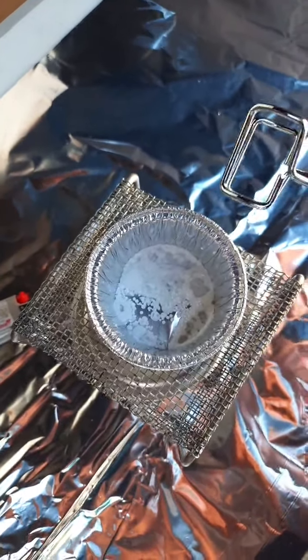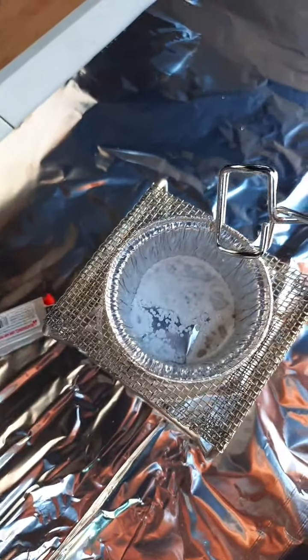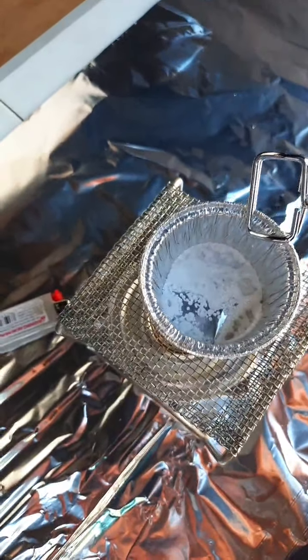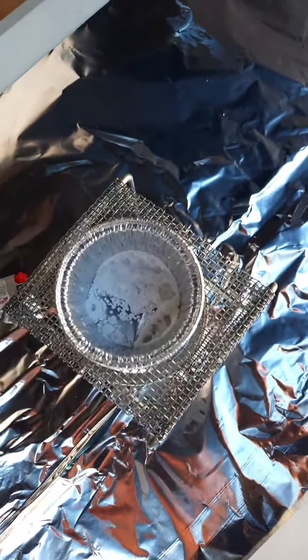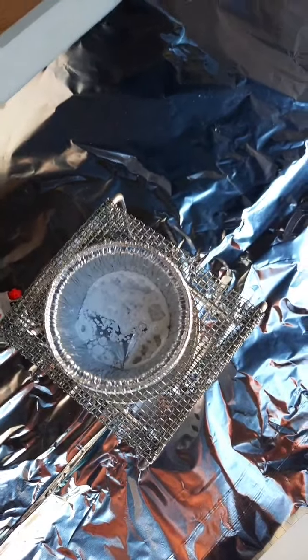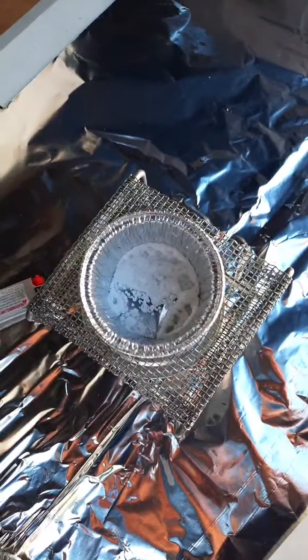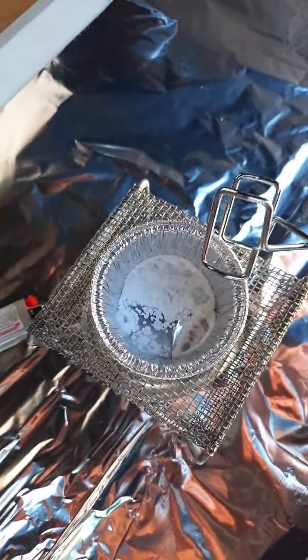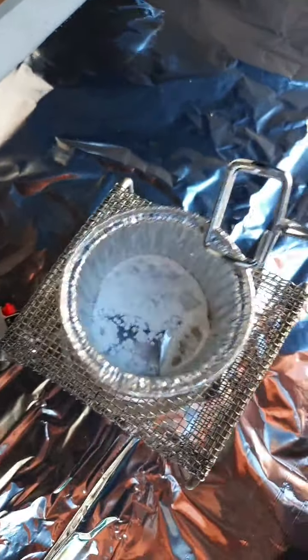Boris recommends you do safety with your test tube clamps and always maintain care. Boris is watching the physical change, and you should comment in your lab on the changes here. Beads have disappeared. We hear the sizzling and popping.